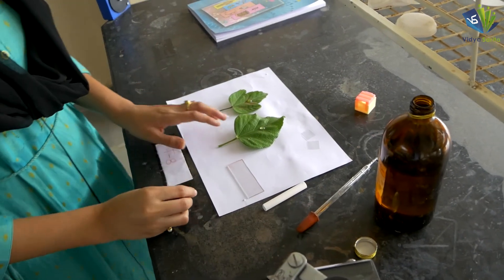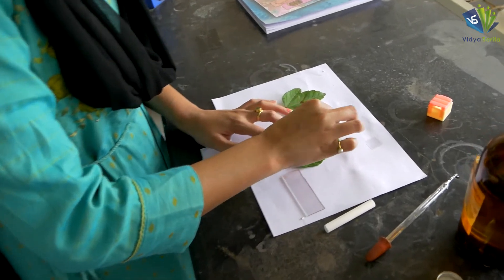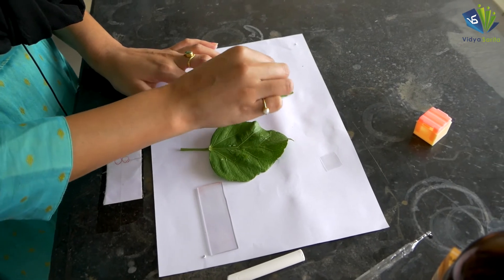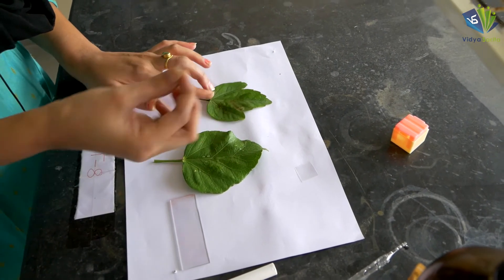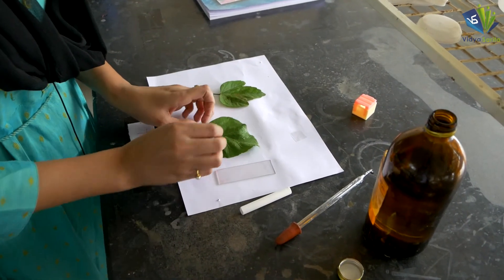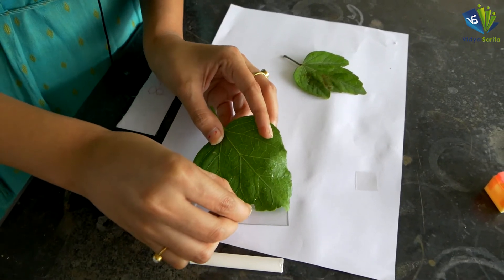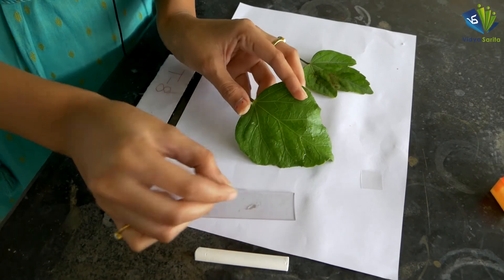Once you are done with it, spread the glycerin with the help of a cover slip, like this. Do the same process on the other leaf as well. After this, take a slide, place it, and smear the material from both leaves onto the slide.